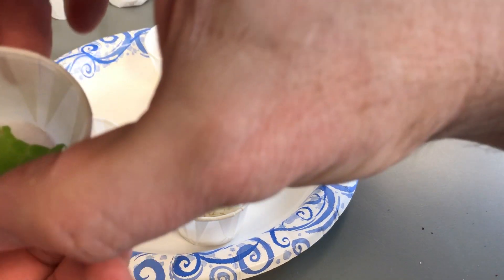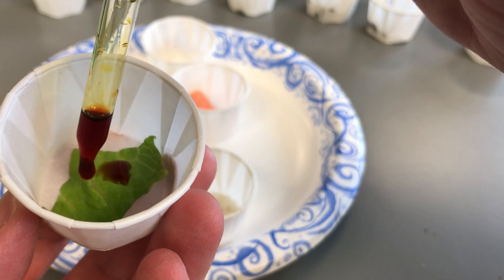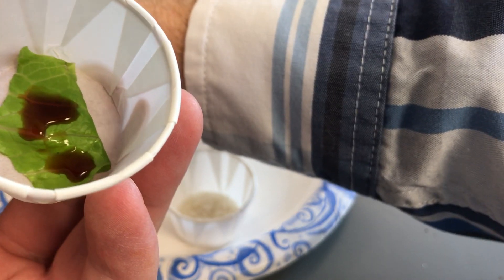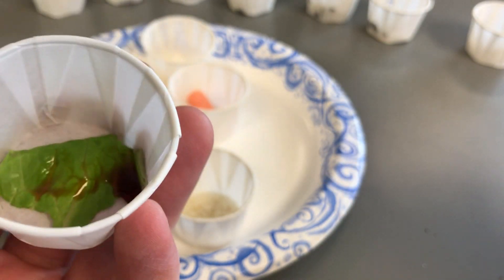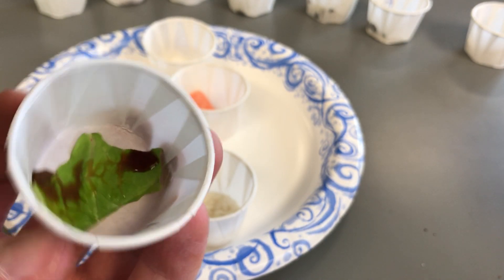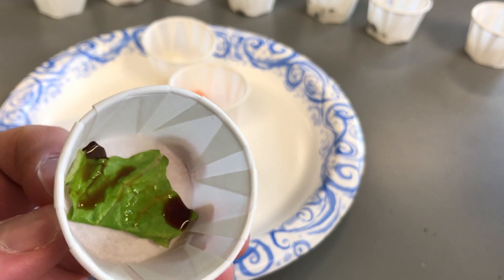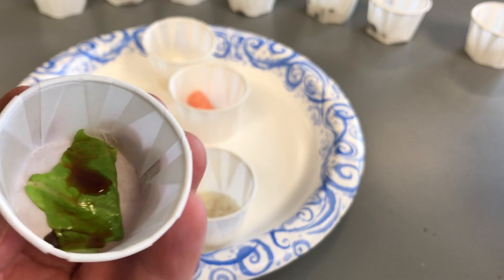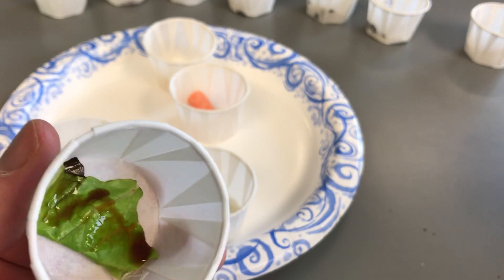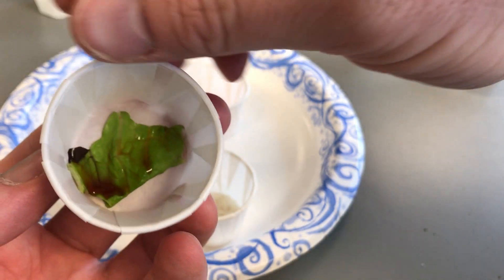Next is labeled spinach but we substituted romaine lettuce. The iodine mostly just runs off. It's lightly colored and doesn't really change. Ignore the black hitting the paper around the leaf — that's the paper, not the leaf itself. The leaf really isn't turning any color. Moving it off the leaf confirms it didn't change and is still amber. Romaine lettuce is a negative result.